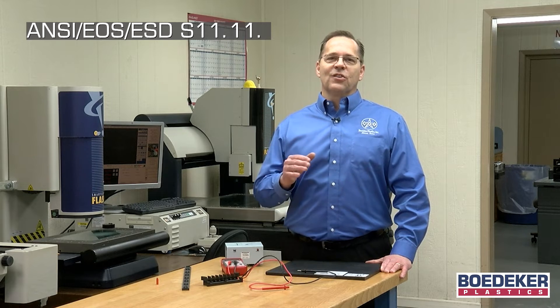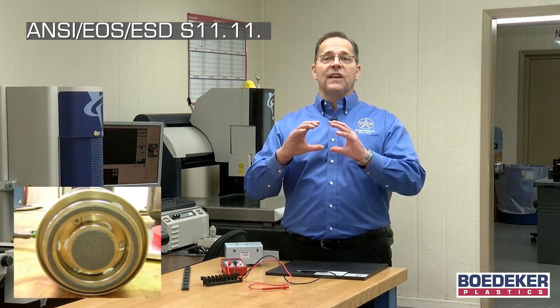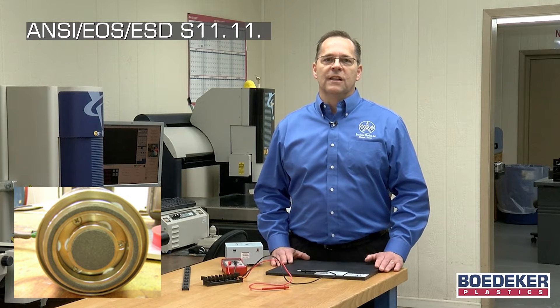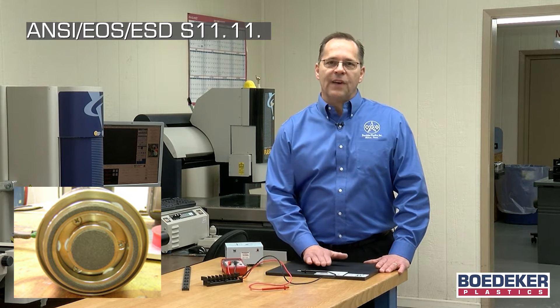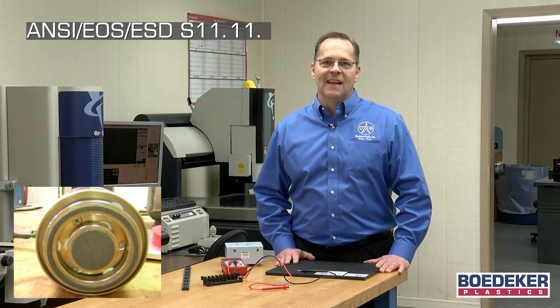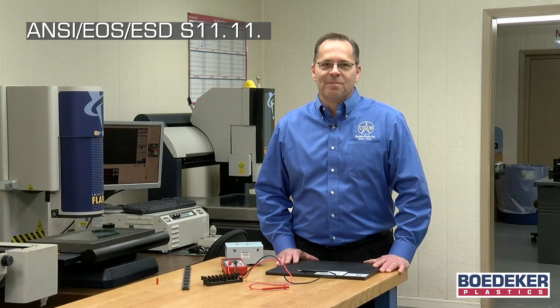The standard calls for the use of a ring tester, which is comprised of two concentric rings made of a conductive material that makes contact with the material under test. The test probe also weighs five pounds to ensure good solid contact with the material, and the test uses a consistent 100 volts. Using this ESD S11.11 test will ensure accurate resistivity readings.